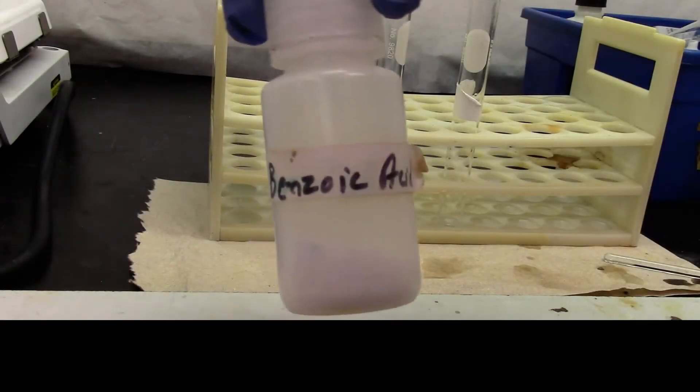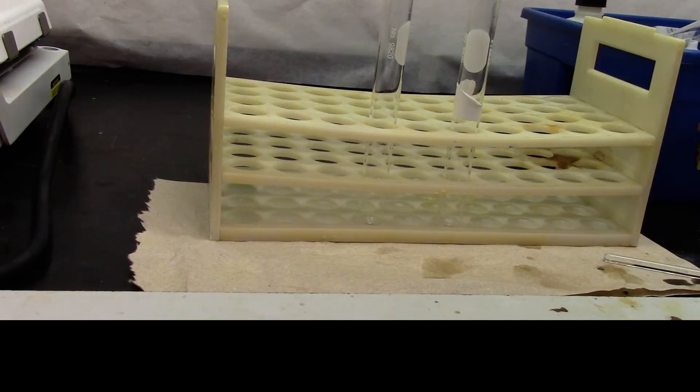We are going to do benzoic acid solubility test. Beta-naphthol is my alcohol sample.